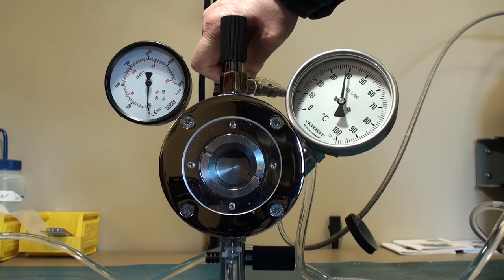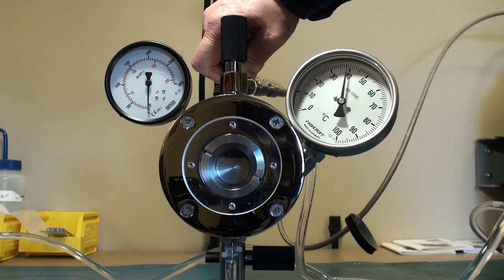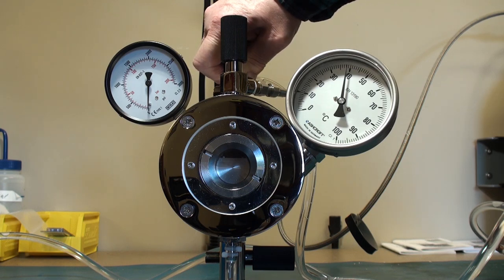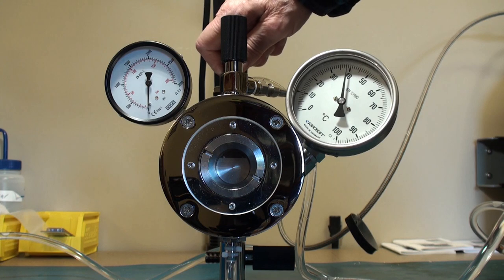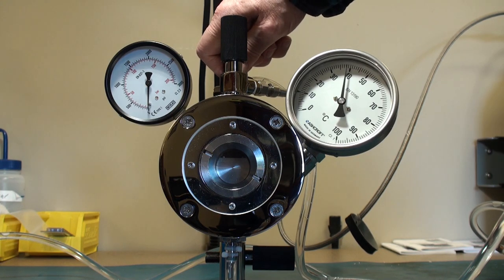A word of caution on the valves. At no time should you use a pair of pliers or some mechanical gripping device to open or close these. These are precision valves. You will damage them. Never use anything more than your fingers to tighten or close the valve.